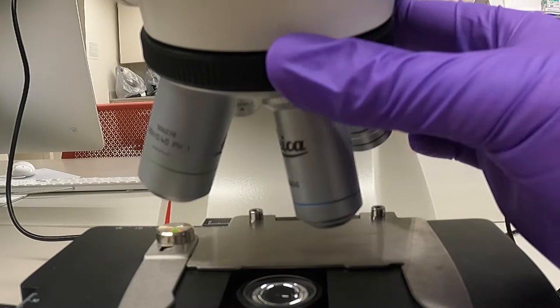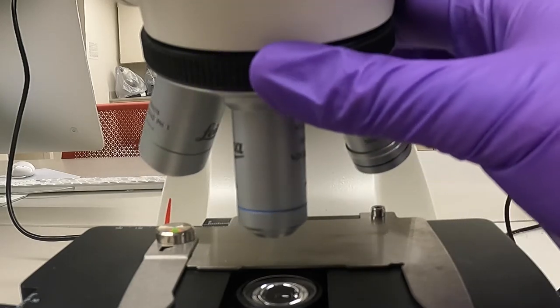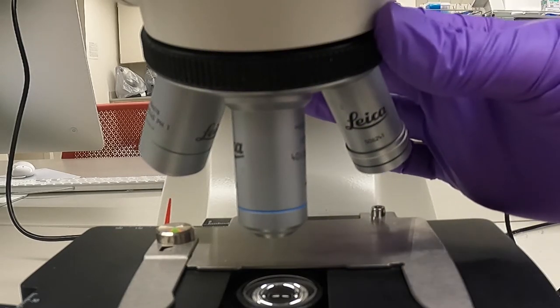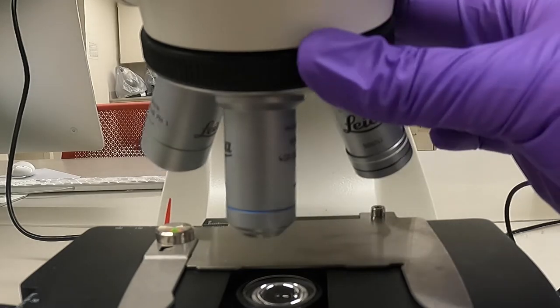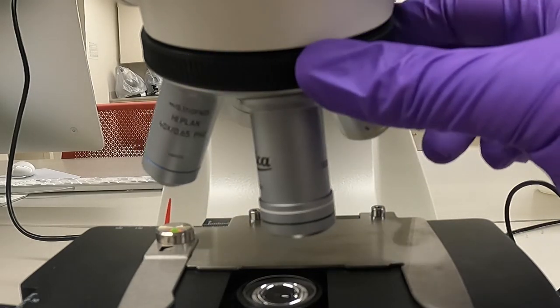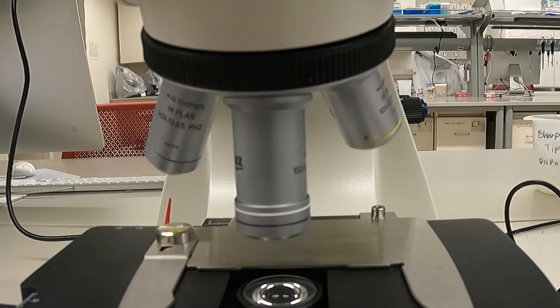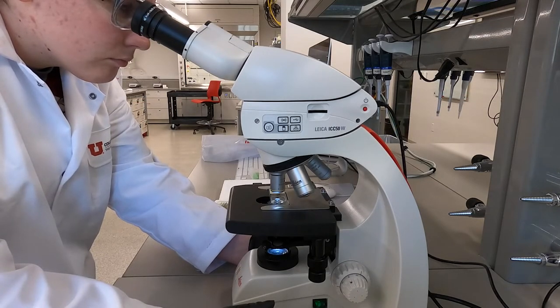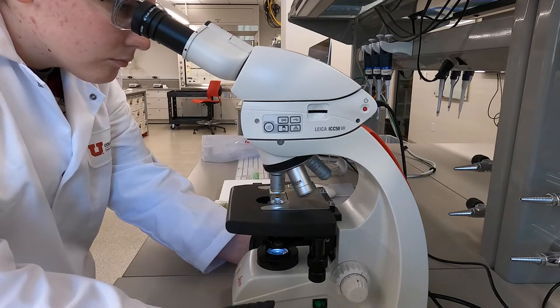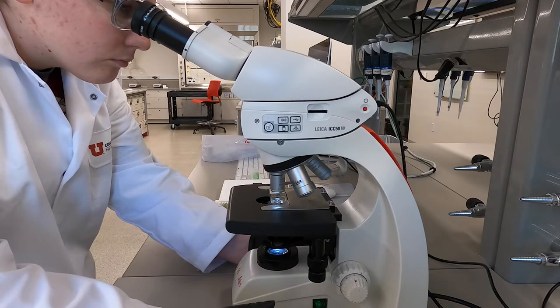Microscopes are parfocal, meaning that if the sample is in focus for one objective, then it should be in focus for the other objectives as well. However, after you have changed the objective, if the image is not clear, you might still need to refocus. When you are focusing at this point, you should only use the fine focus knob.